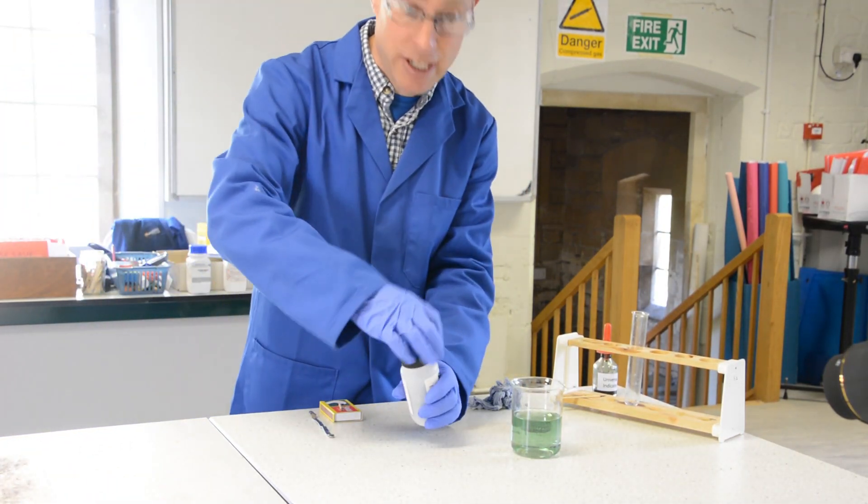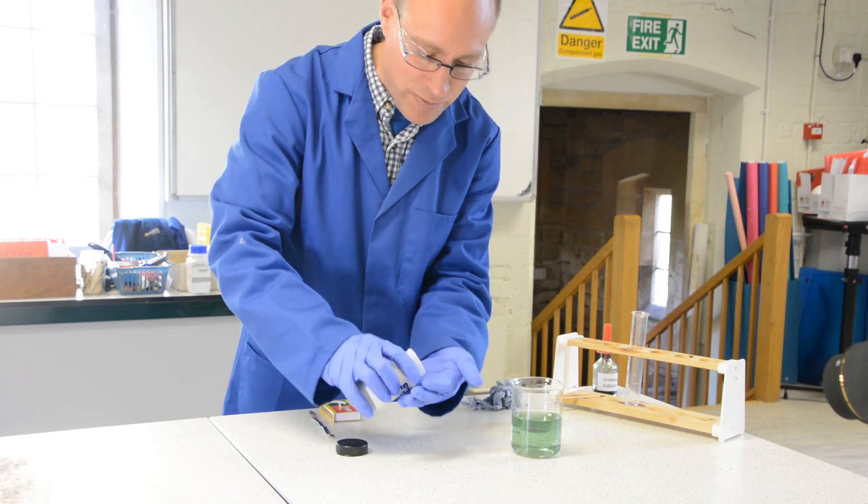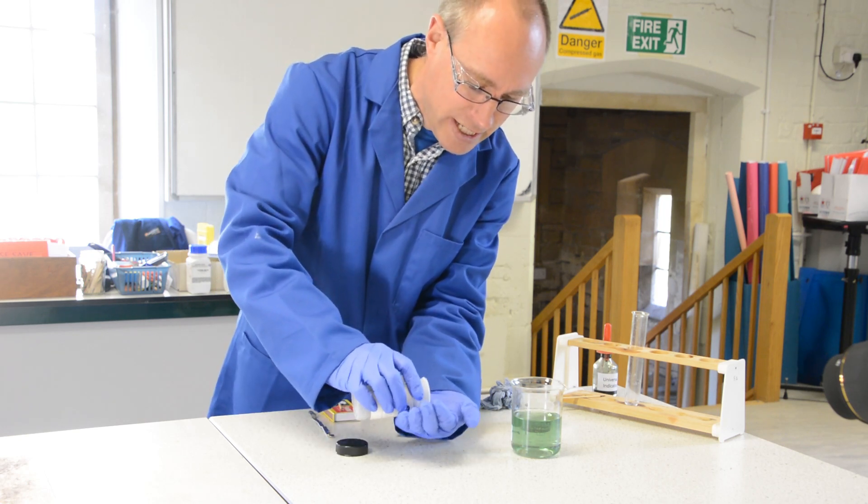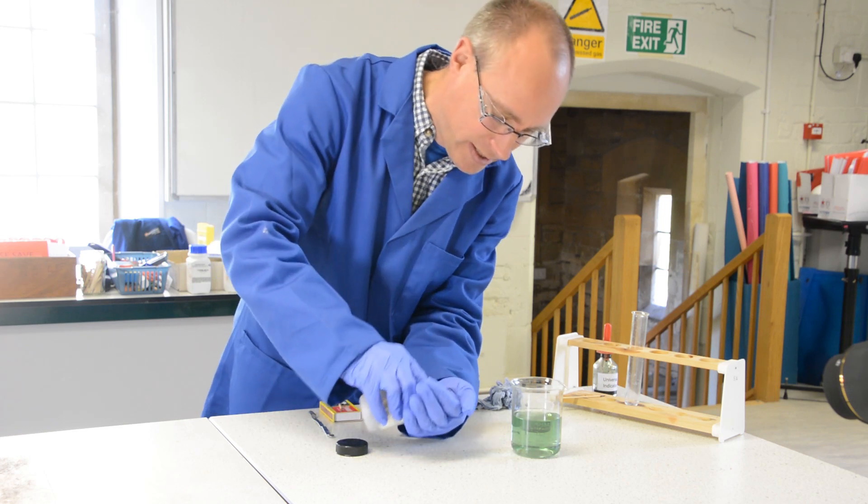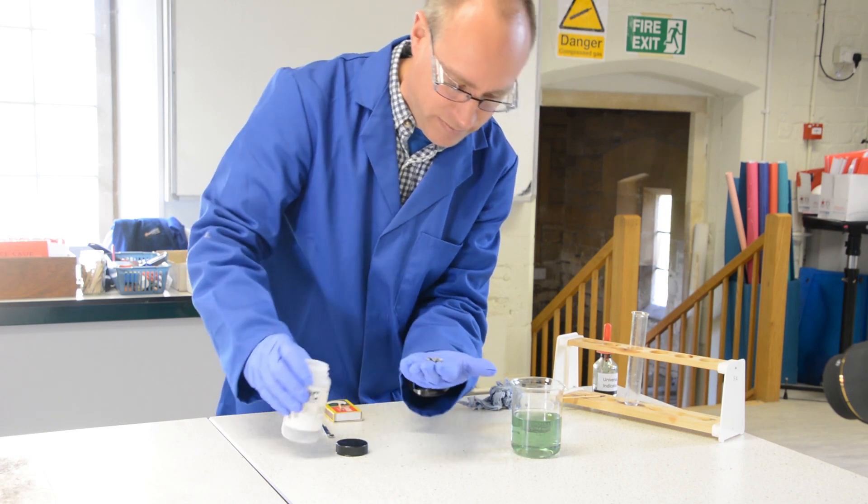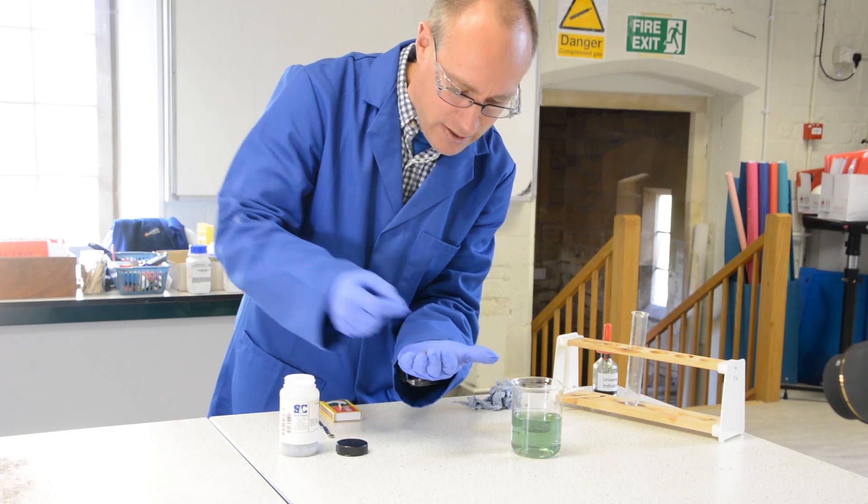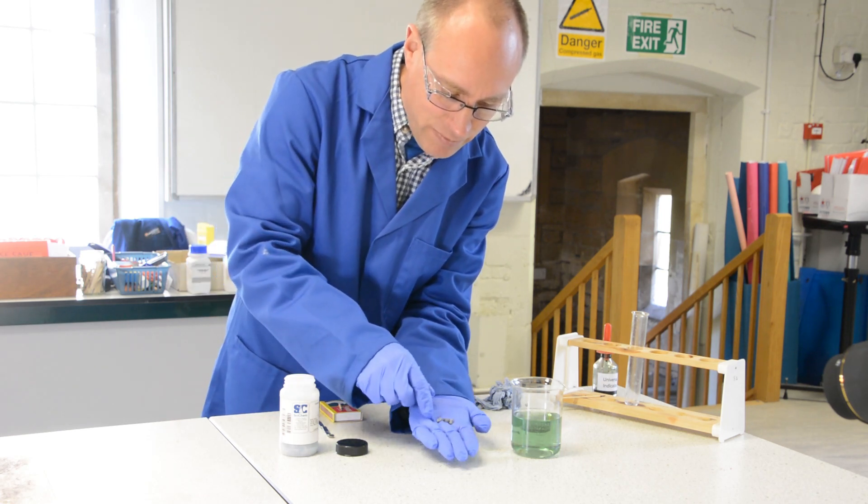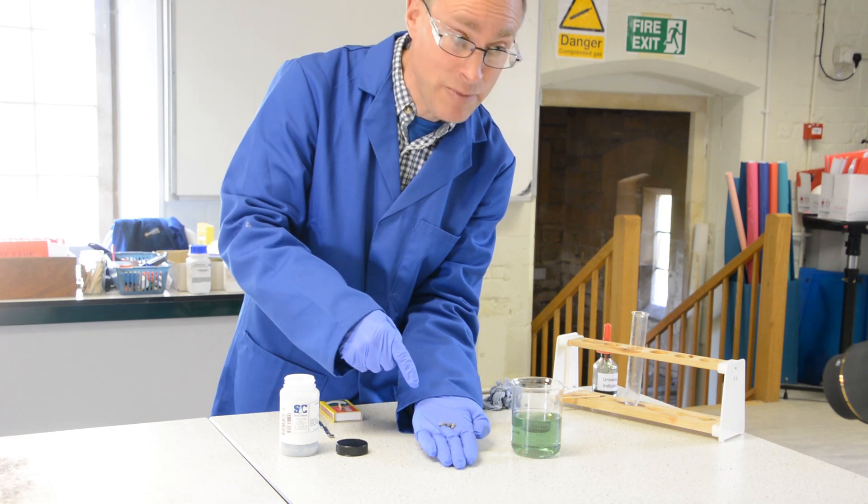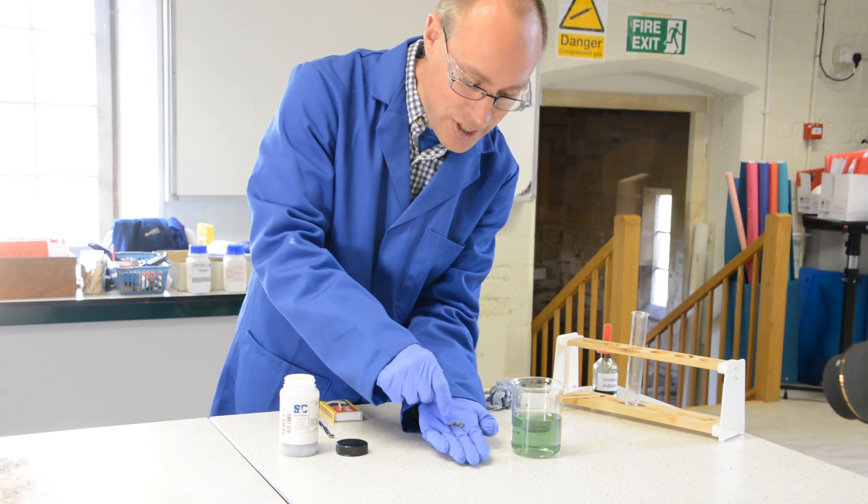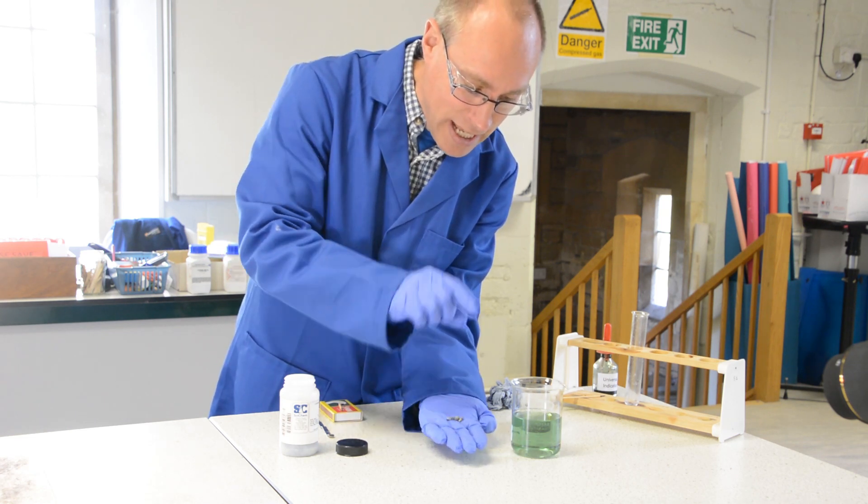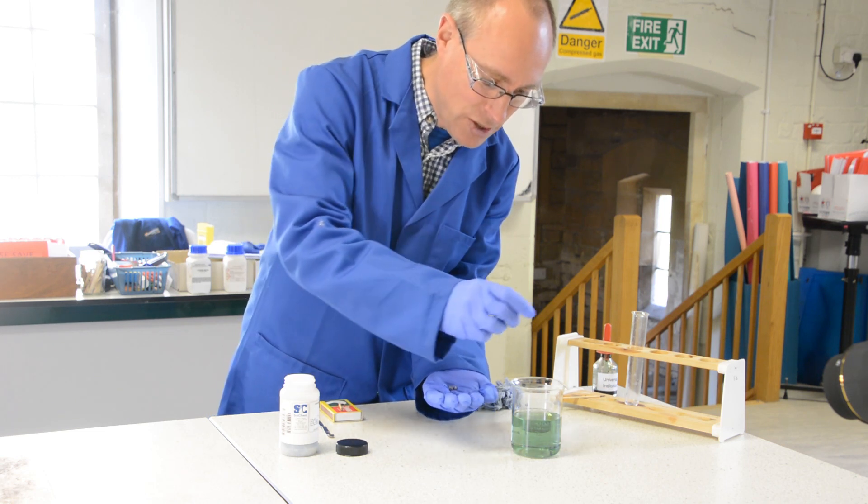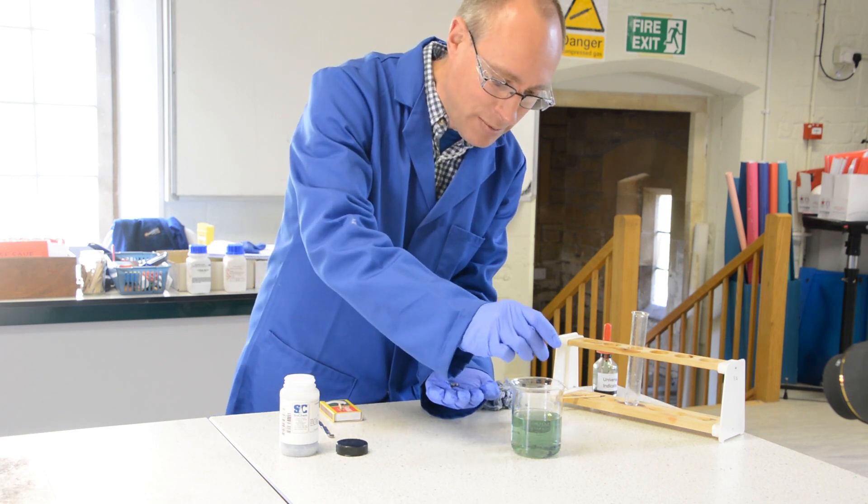I've got in this pot here some granulated calcium. So the calcium there, like a metal, it is a metal, so you can see the grey of it. And as I pop a couple of bits into water we'll see what happens.